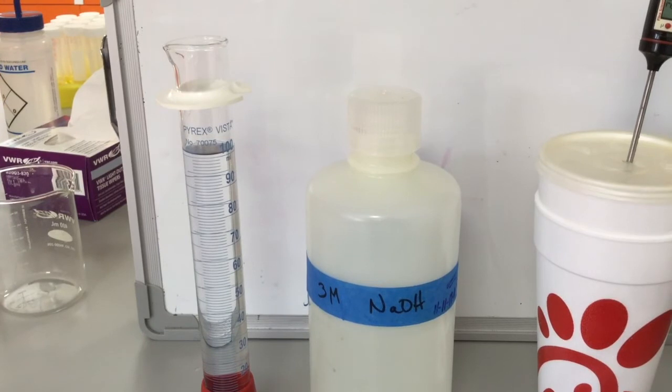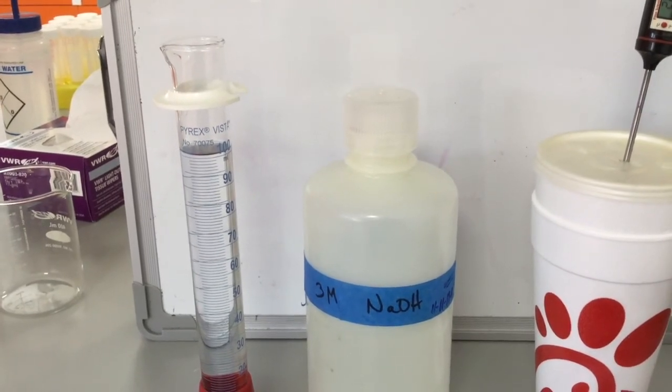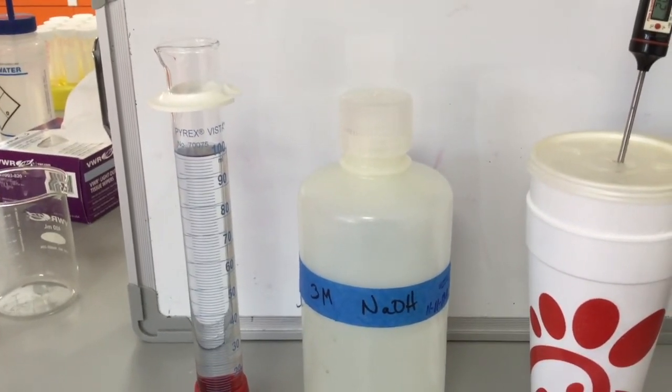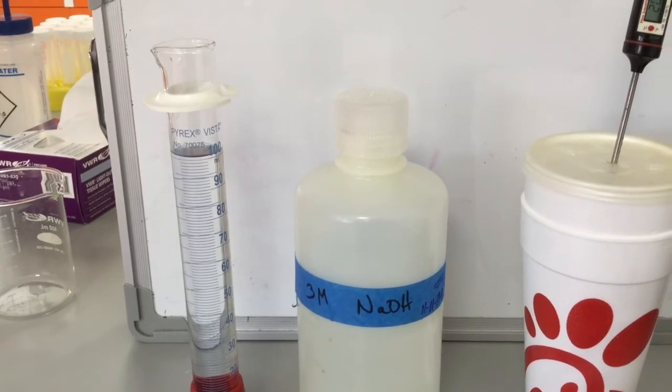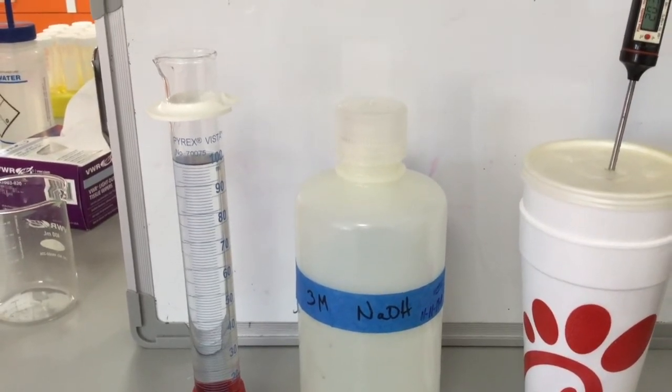Best practice is to rinse first with deionized water and then take a small amount, just a few milliliters of sodium hydroxide, rinse with that as well, and then fill.